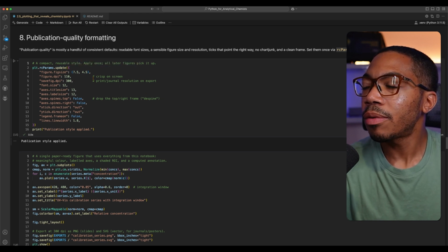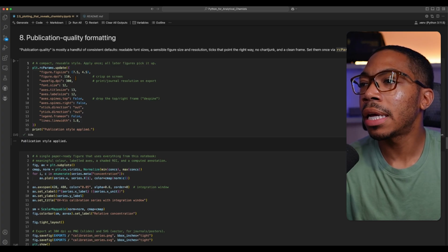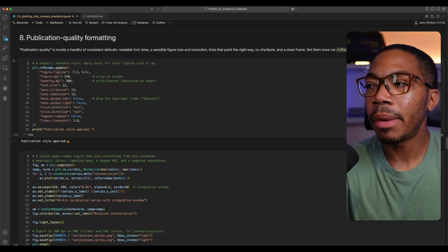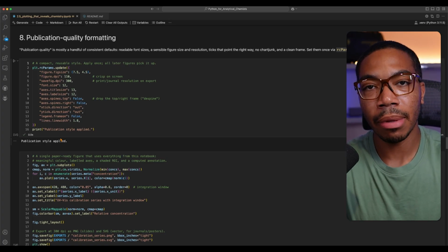So in this case, let's say we want our figure to be 7.5 by 4.5. We want a particular DPI. We want a particular font size and all the other specs. We can take a lot of information and save that and call this our publication guide. And some journals actually have the specs they want for your figures. You can encode them here, and all the figures in this notebook will match those parameters.